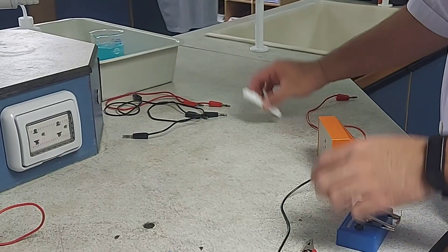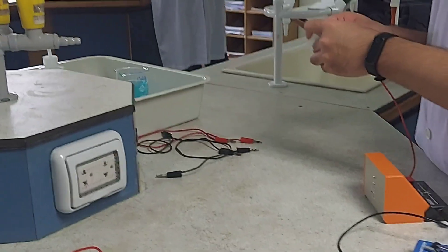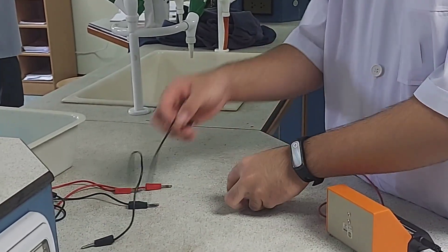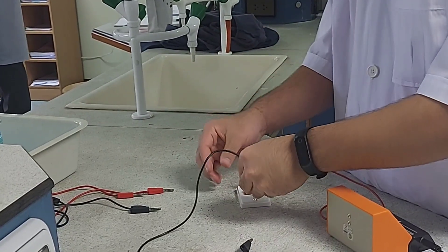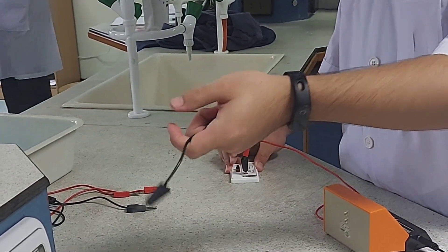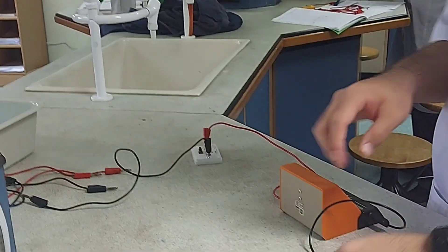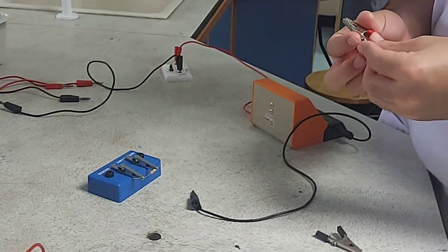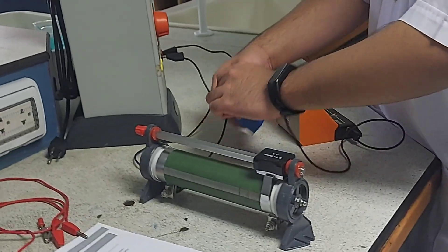For this experiment, you must wear eye protection — safety goggles — at all times. Copper sulphate solution is harmful if swallowed and can also irritate the skin. Sulfuric acid present in the copper sulphate electrolyte is an irritant. Ethanol is highly flammable and is harmful if swallowed.